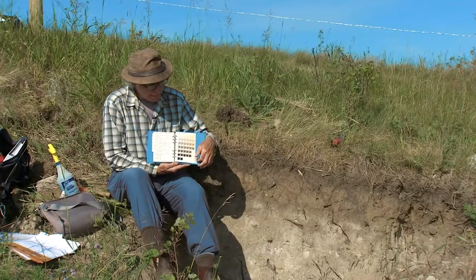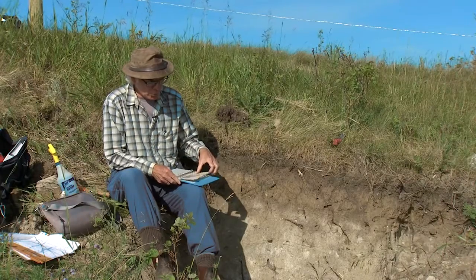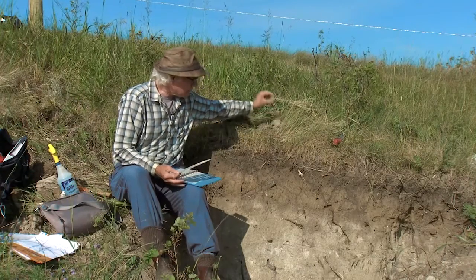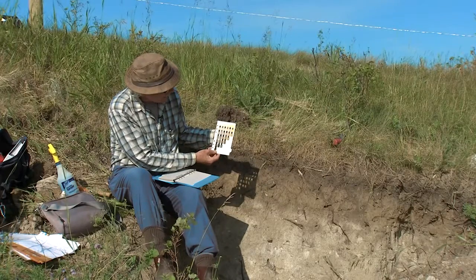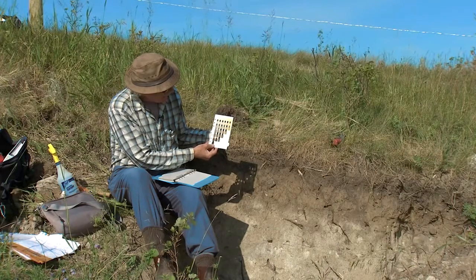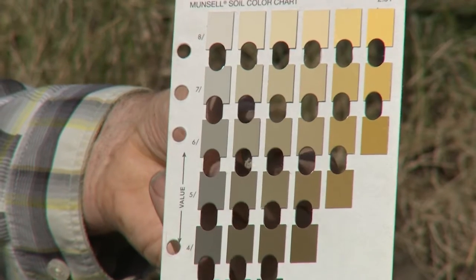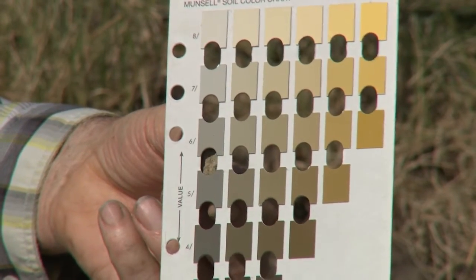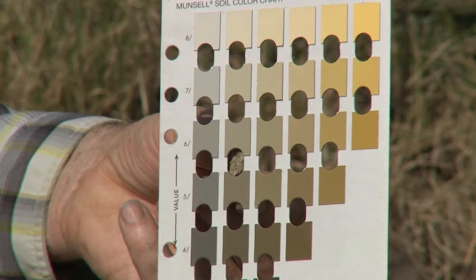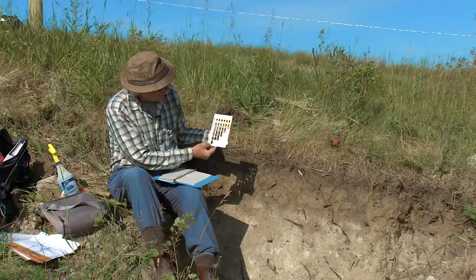We'll begin with our C horizon and turn to the 2.5Y page. I'll take that page out so I can hold up the material behind it. You simply get a piece of the soil and hold it up behind the Munsell chart to find the color it most closely matches. In the C horizon we have some very white calcium carbonate, but we're trying to get the dominant or matrix color. The closest match for the dry soil is 2.5Y, with a value of 5 and a chroma of 2 — so 2.5Y 5/2.